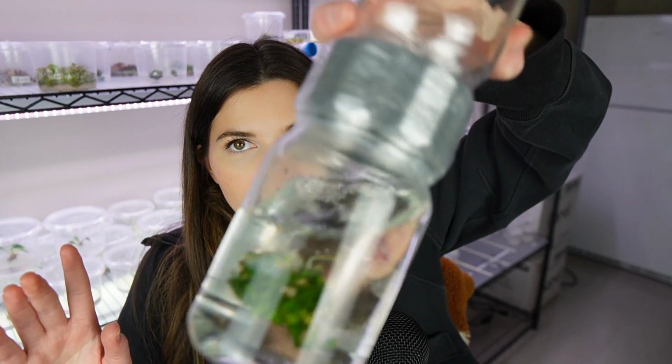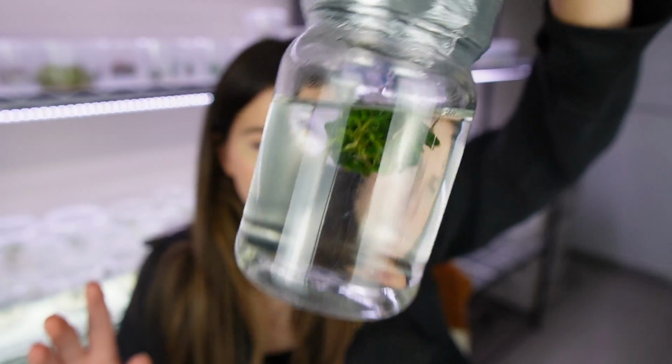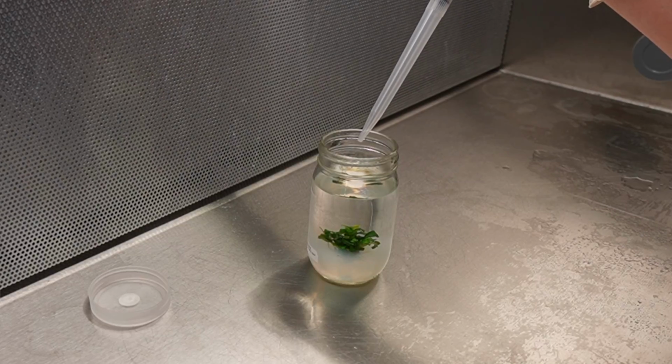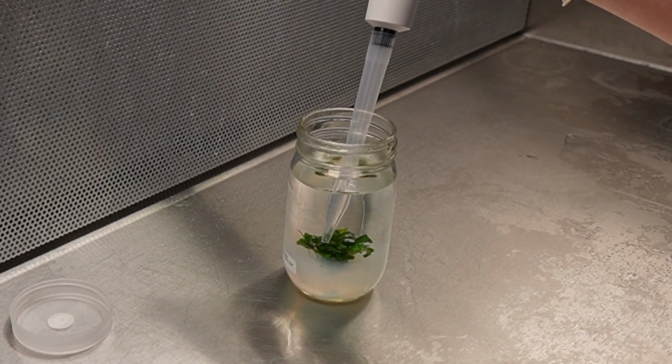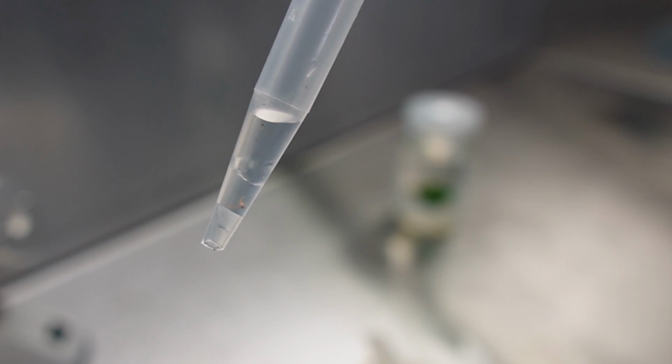I got ahead of myself, but the BioCoupler with the Bucephalandra is likewise not contaminated. There are some chunks in there, but that's just the agar that I didn't fully remove. Yesterday, I decided to remove the fruit fly from my experiment using a micropipette. I sterilized the tip so that I could insert it into the container without contaminating everything, and I was able to successfully remove our fruit fly friend this way. I'm gonna let these continue to grow, and then in about a month I will probably transfer these plants onto multiplication media so we can start trying to actually clone them. Just the Bucephalandra. The rest are going in the autoclave, then the trash.